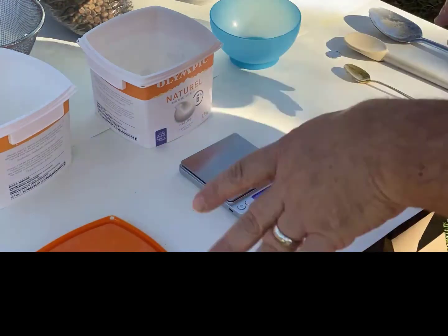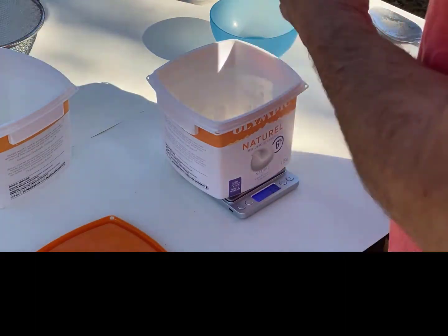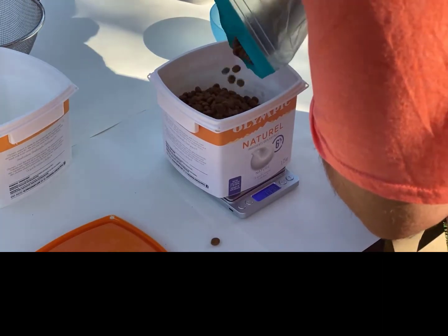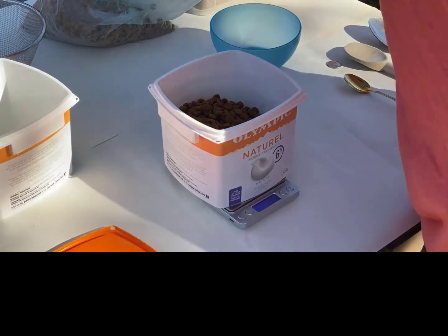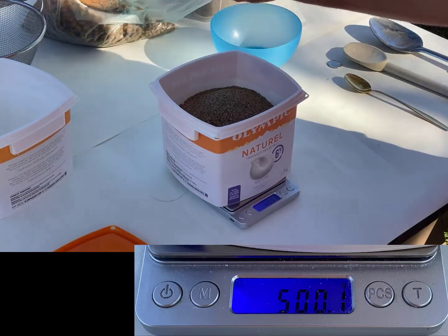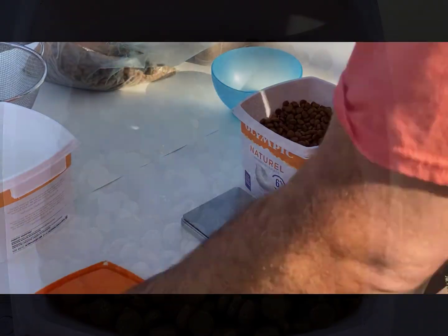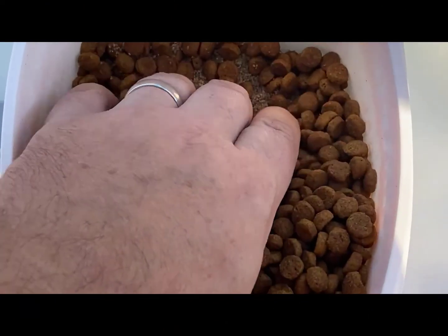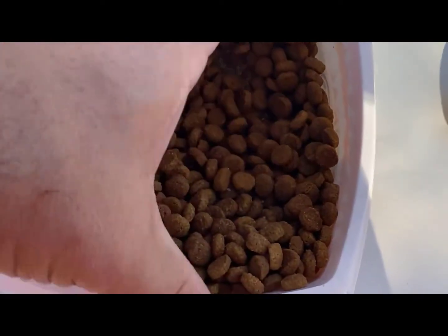The first step is to make our 50-50 mixture. I'll put my container on the scale, tare it, and then add 500g of kibble. I'll then re-tare the container and add 500g of play sand. Close the container and mix well. Due to the differences in size, shape, and density of the two particles, the mixture has stratified with the sand settling mostly near the bottom and the kibble mostly near the top. This is our first clue that sampling our mixture could be a problem.